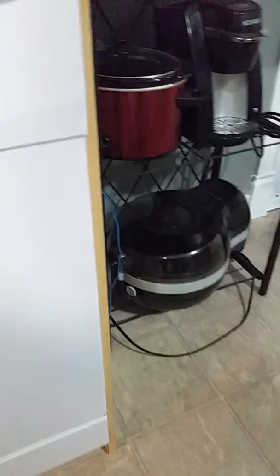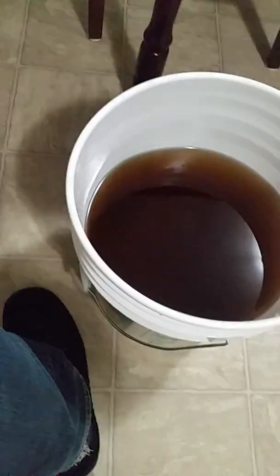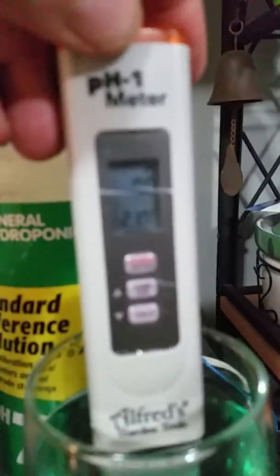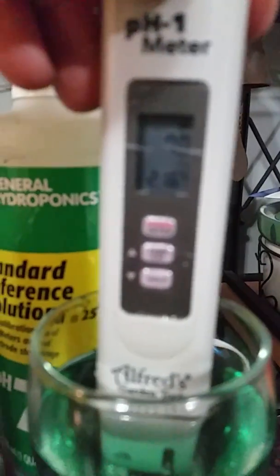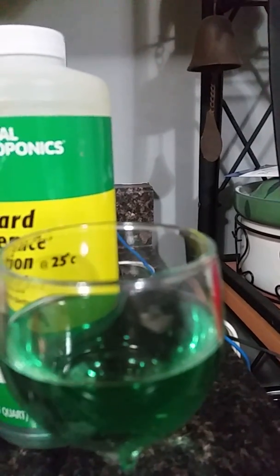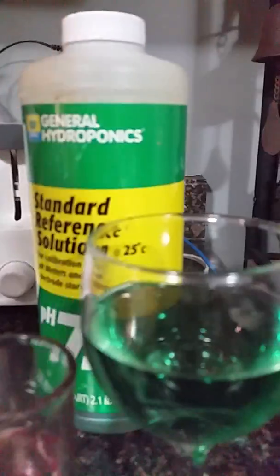To make sure, I'm going to give this a little rinse. My temperatures in my bucket and my solutions are all the same, so this should go to seven. And if it does not go to seven, recalibrate and redo it all again, because I can guarantee you you're going to be in for a heap of trouble if you don't.